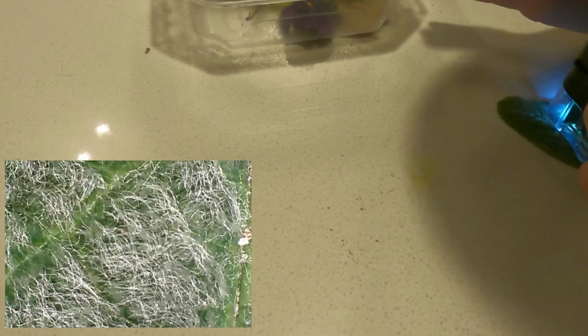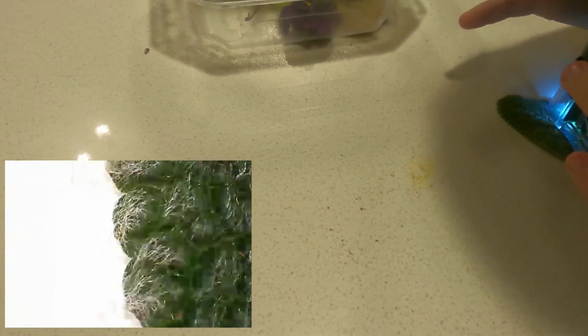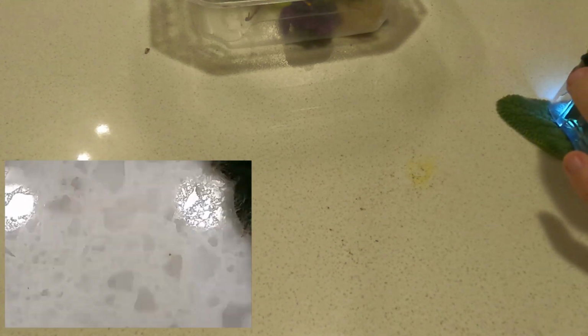That's the lamb's ear. I got Lindsay. Let's check out the lamb's ear. Oh my. Okay, you have to see this then. Look at this. Did y'all look, that's a hairy leg. Oh, wow. Henry, look at this. It looks like a giant's hairy elbow. But it's like a green giant's hairy elbow.